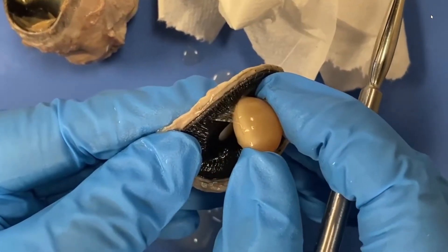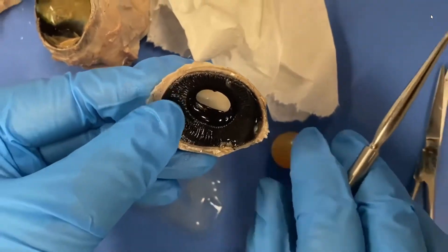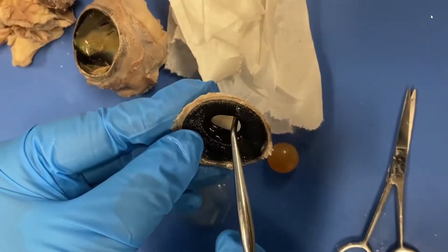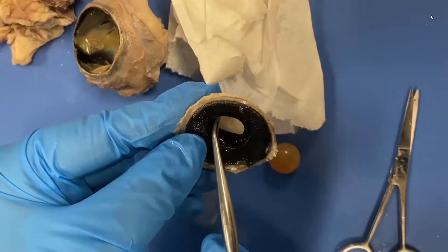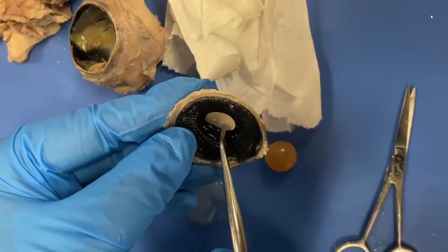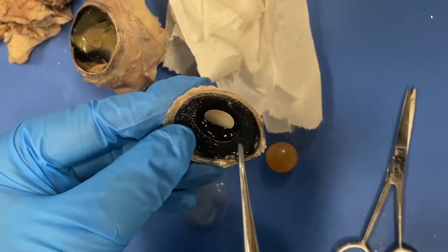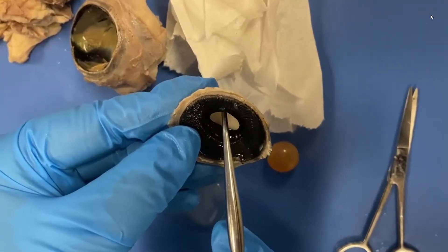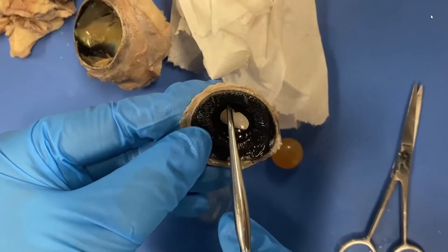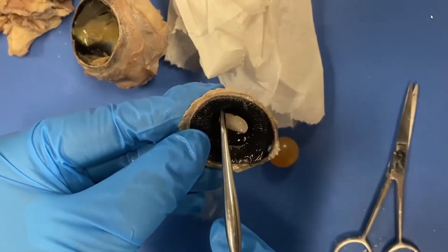There go the suspensory ligaments — you can see them right there. I'm going to pop those suspensory ligaments — pop, pop, pop, pop, pop. You can see a few left, and we can get back here. Now you can see the cornea again. The cornea is the clear part. The hole is the pupil.